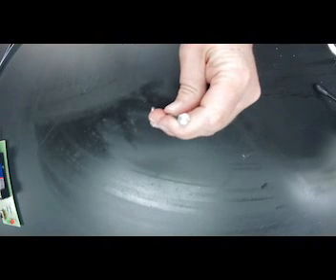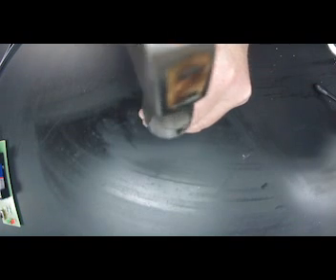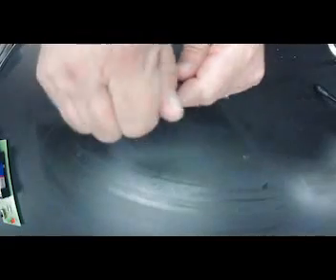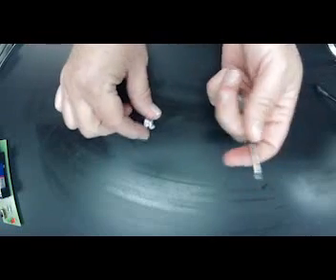So I'm going to go ahead and look at tapping. So I'm just going to tap it. Does it break? And this tells me malleability. So notice as I go through, it's not shattering. It's not breaking. It's just making a hole. So this definitely is very malleable. And that's why we can have aluminum cans. So let's look at the periodic table.